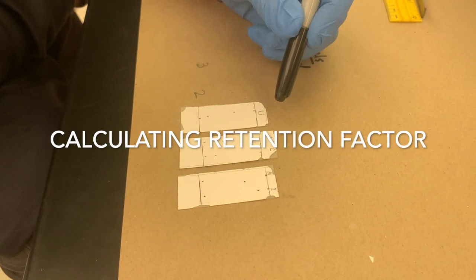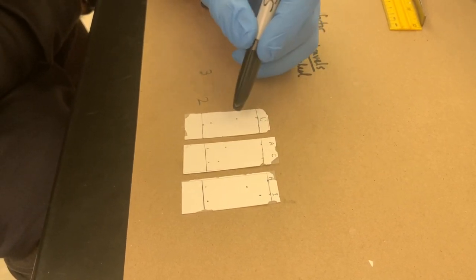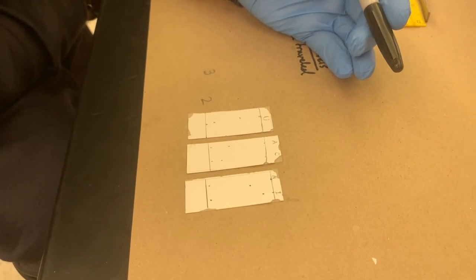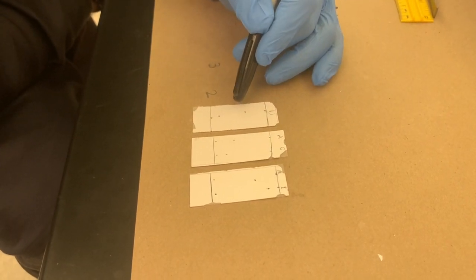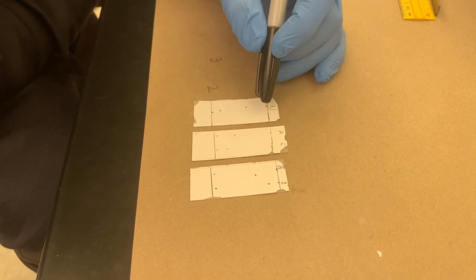Looking at our TLC plates, you can see that I've taken a pencil and marked the centers of all of the spots that were visible on the plates under the UV light. It's much harder to measure those spots if you're working with the UV lamp at the same time, so I highly recommend doing that instead of trying to work with both a ruler and a UV lamp. You're probably just going to get bad measurements.